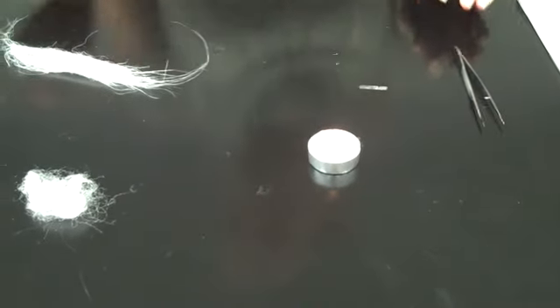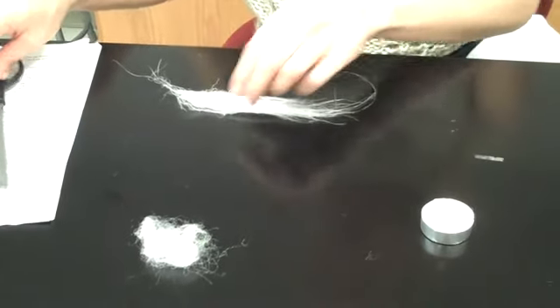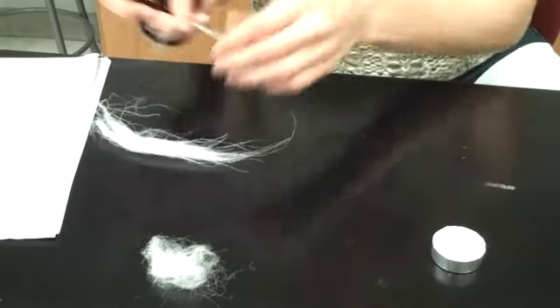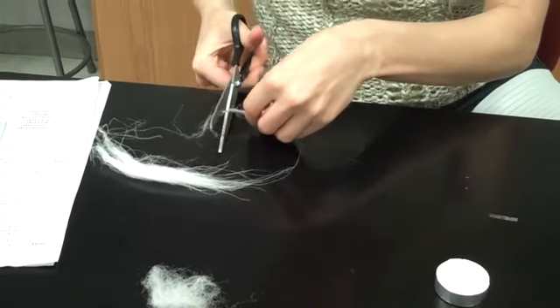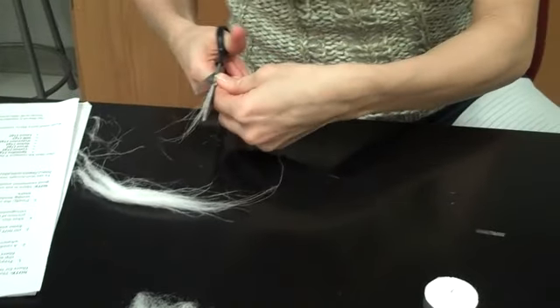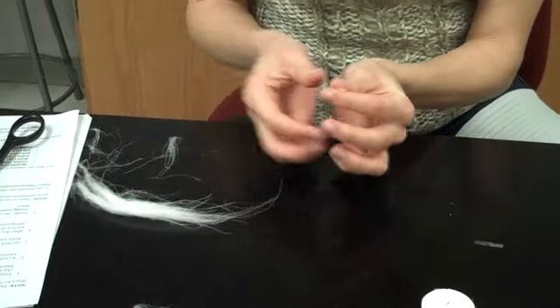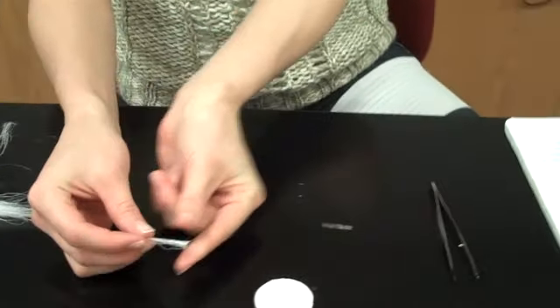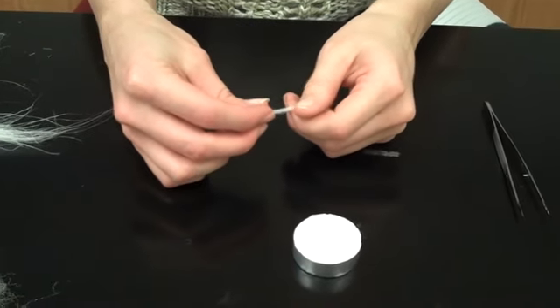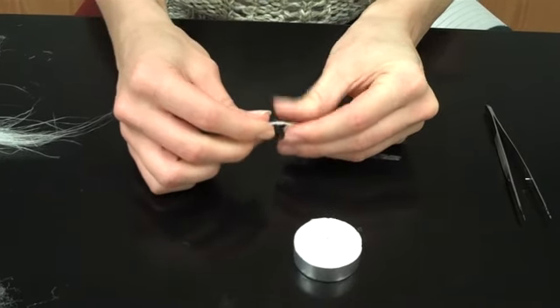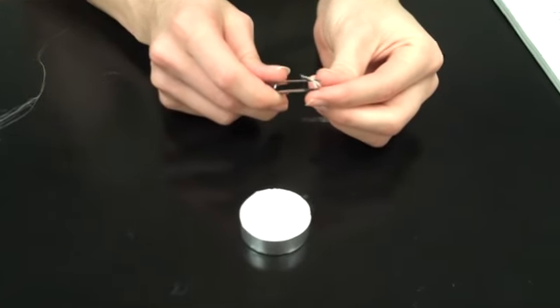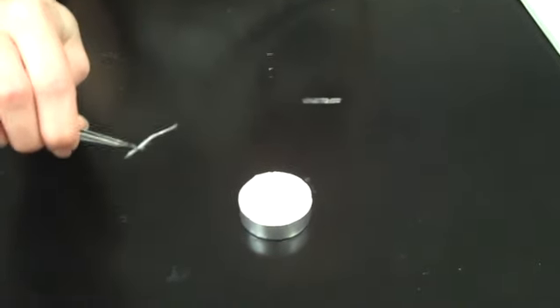To start with, I've got this unknown fiber right here. To do my test, I'm going to pull off just a little bit of it. That's still too long, so I'm just going to cut myself a nice little section. Now I've got a good section of fibers to use. What you want to do is twist your little tuft of fibers together to make it nice and compact, so that what you're getting is actually a result of the fibers burning and not air trapped between them.